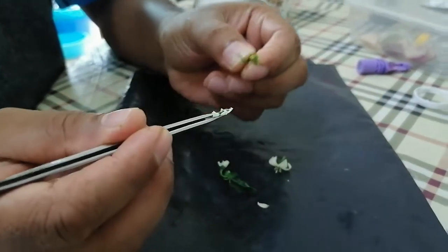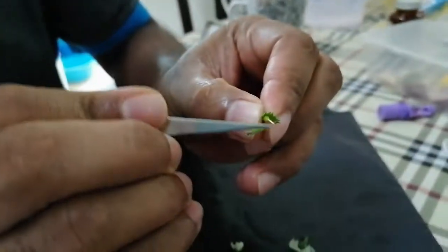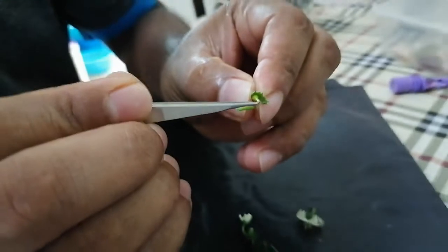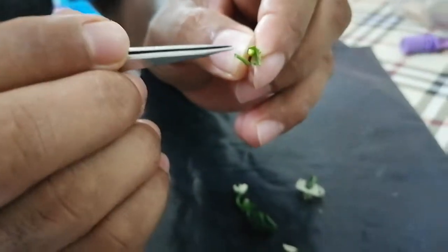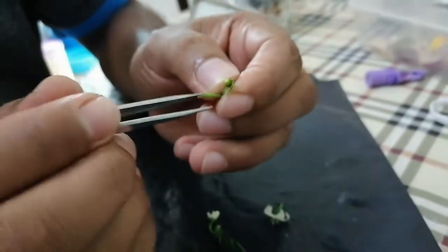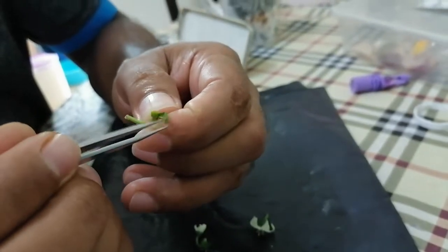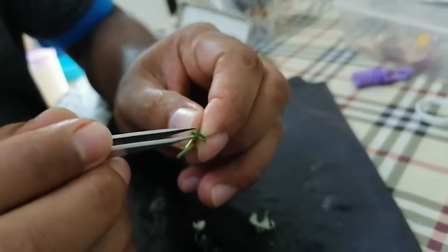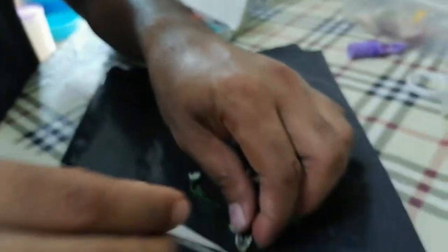I have removed some parts, and I'll show you later. This is the stigma — the top is sticky, though it's difficult to show this way. This is the ovary. And all these are sepals — they also have five sepals, all together.